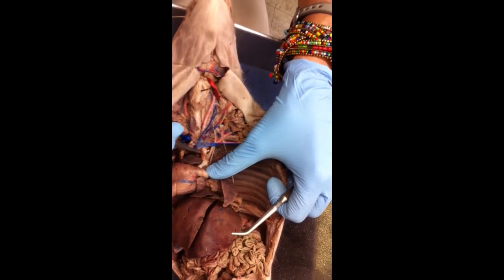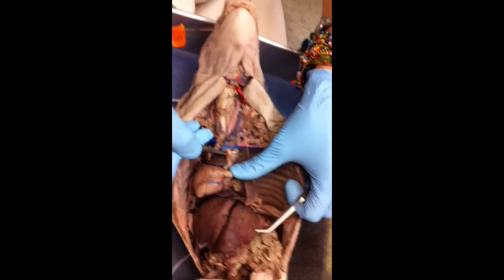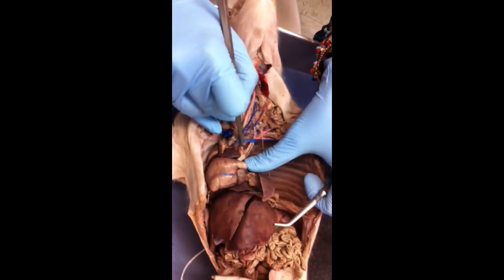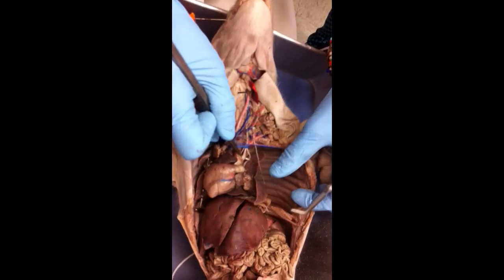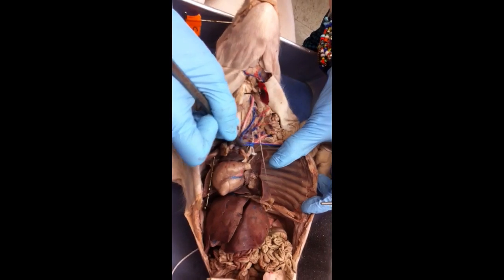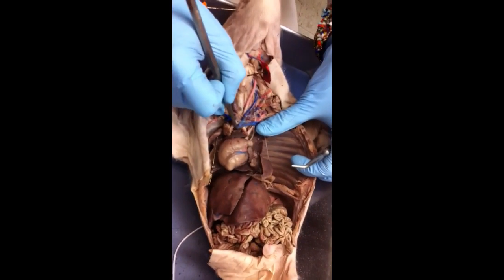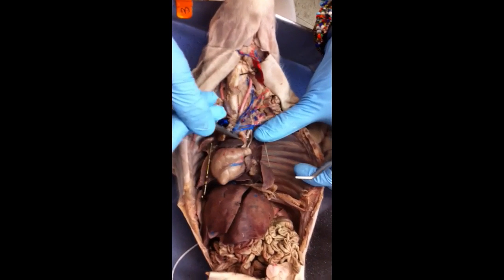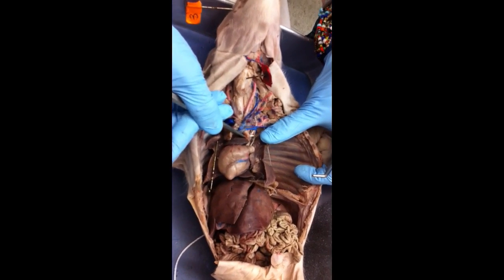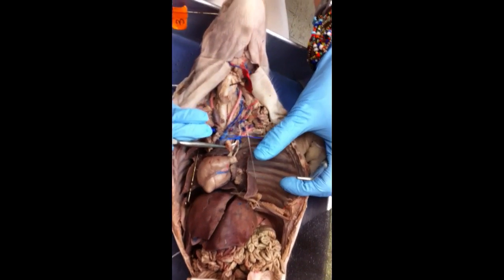The first finger is the, which artery? Yeah, the brachiocephalic artery. Now the second finger is on which side of the pig? Left. It's the left subclavian artery. So brachiocephalic should make you guys think of two words. What two words? What regions? Brachial and cephalic, so arm and head. So this is taking oxygenated blood to the head and upper extremities.